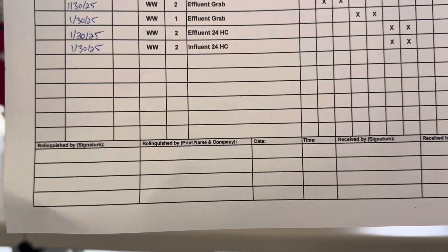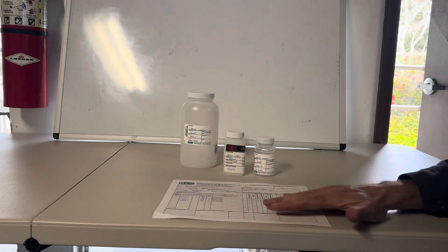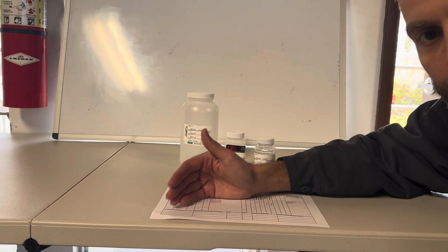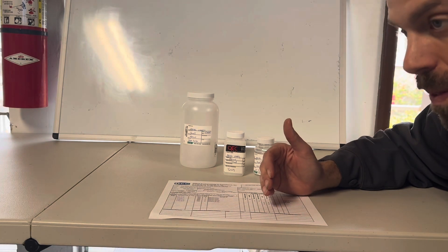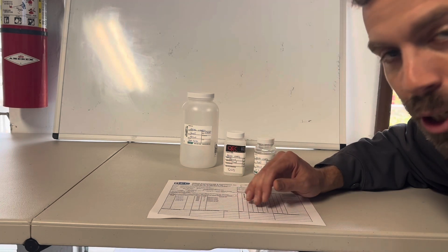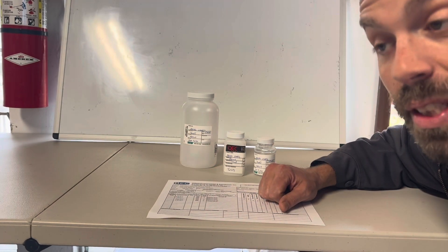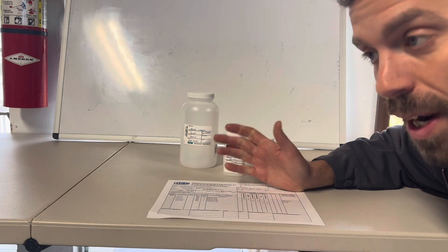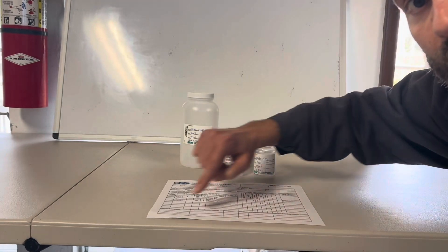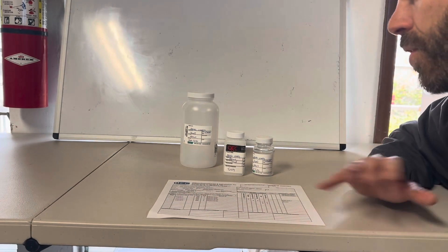On the bottom of the chain of custody form, you have 'relinquished by' — a signature, printed name, company, date, and time — and then 'received by.' That's the actual chain of custody. I take the sample as the sampler and relinquish it to someone — in our case, a courier, because we outsource to a third-party lab. We're not big enough to justify our own lab accreditation, equipment, and personnel. The courier relinquishes it to sample receiving at the lab, and then it goes under analysis.